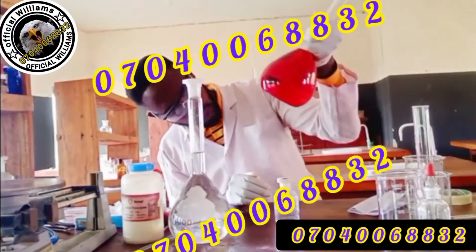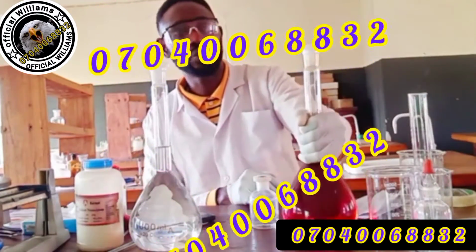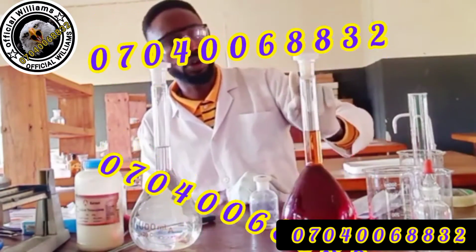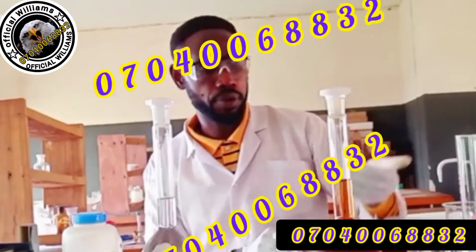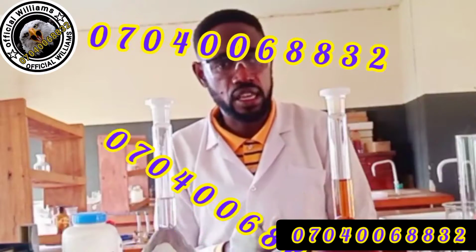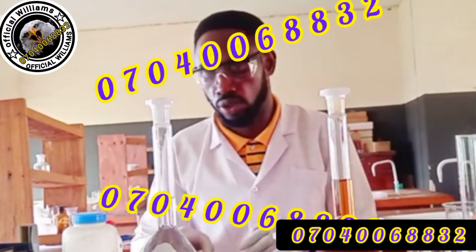If you check well, you will still see the iodine is undissolved, and it will remain that way. If I should come back tomorrow, all this thing is already stained, which means the iodine is even evaporating as you are even talking. So consecutive titres are not even concordant. So what must we do in this case?